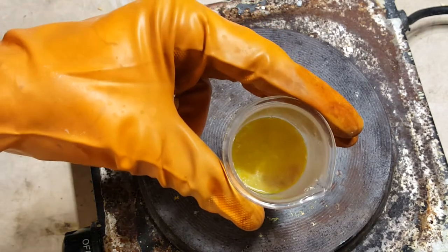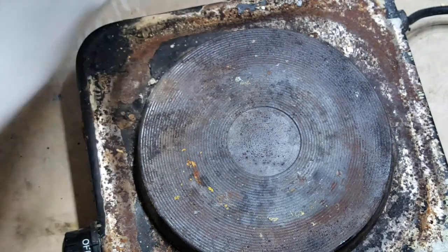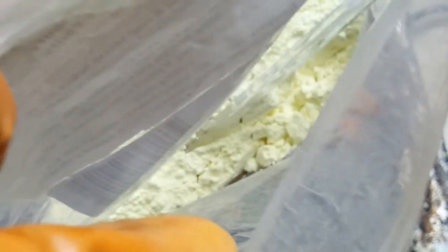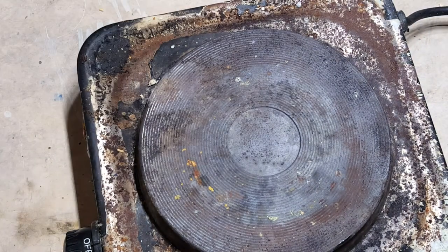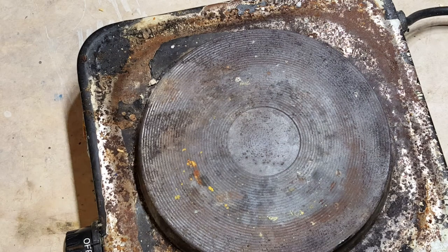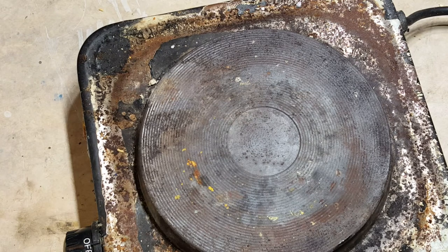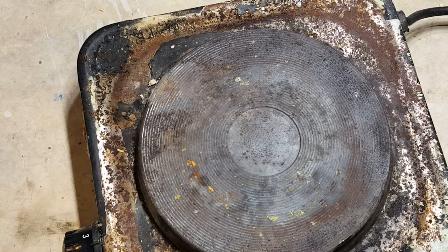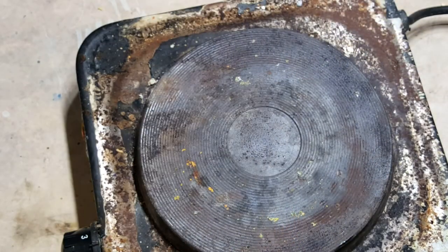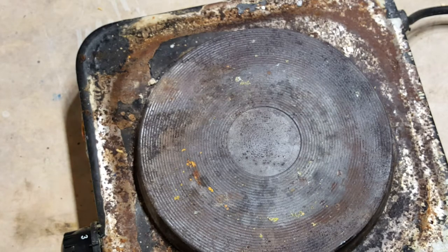Here's a typical crystal of sulfur you'll find around volcanoes. Sulfur is often crushed into a powder to make it easier to use for reactions. Before I melt the sulfur, it may ignite while I'm heating it and produce sulfur dioxide, and I don't want to be breathing that, so I'm going to put my respirator on along with my goggles. Definitely don't want this in my eyes. I'm going to start melting the sulfur.